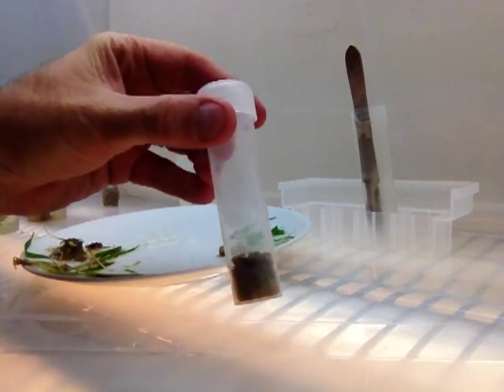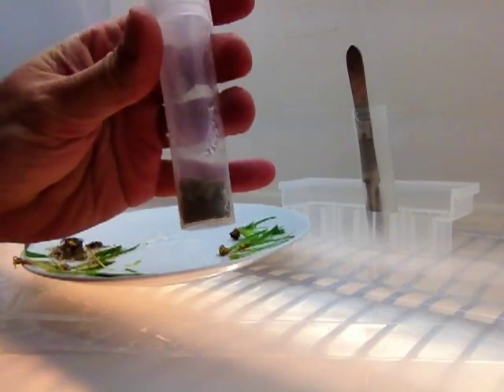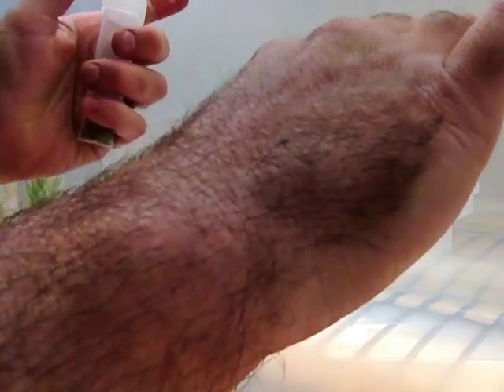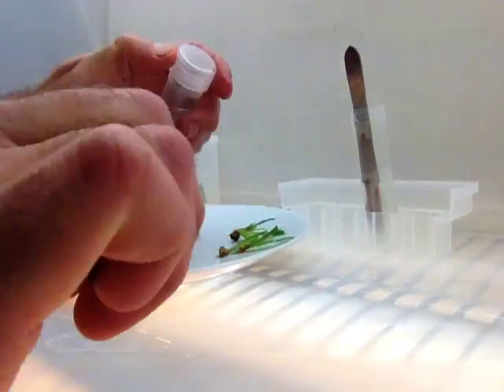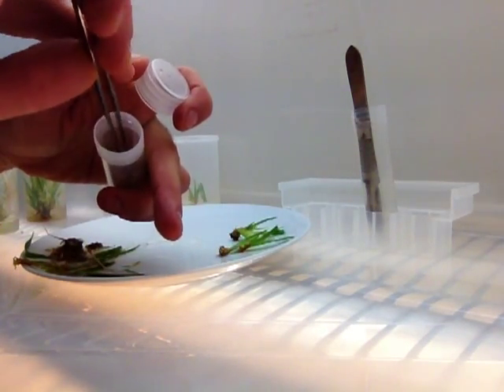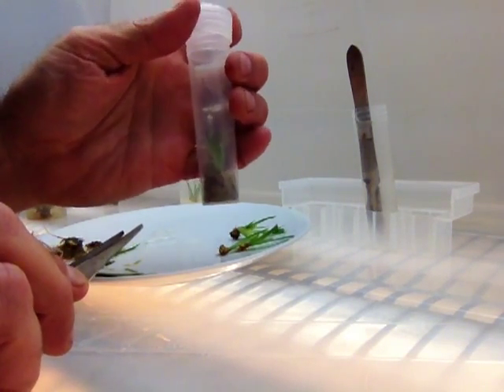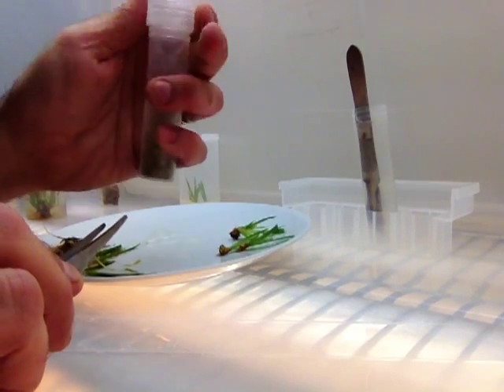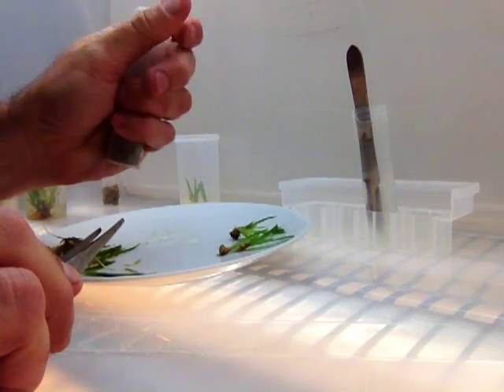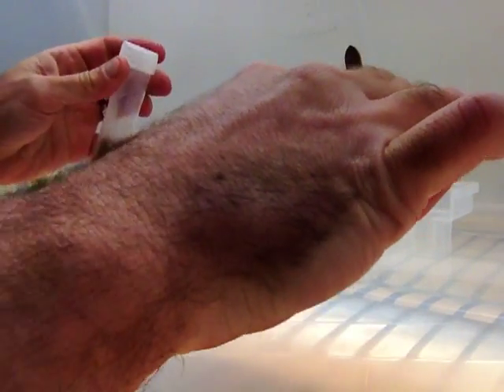Here's an experiment I'm doing. This is rock wool, and I've dribbled some of the nutrient solution over it and cut it up into small squares. I'm doing this because I'm friends with the Grodan people and I really like the Grodan material. I'll just stick that down in there — you can see it's got some moisture in it. Screw the lid almost all the way down, back a little bit so it still breathes. All these vessels still breathe air. I just seal them before I use them to make sure they stay clean.